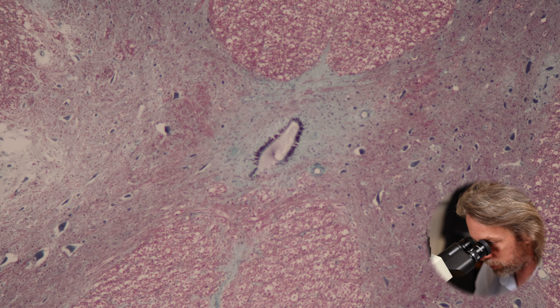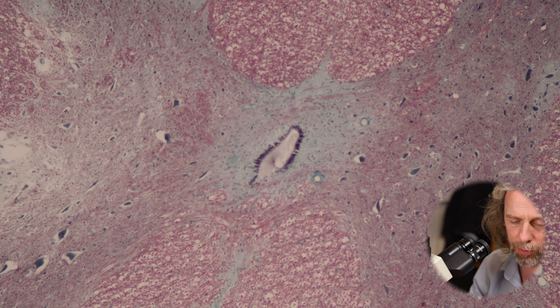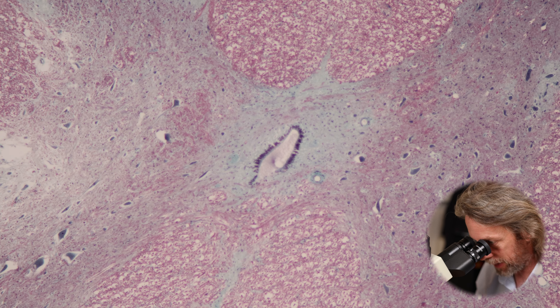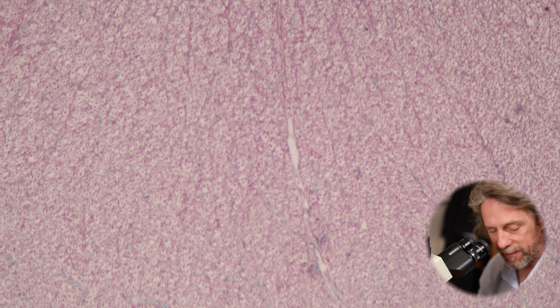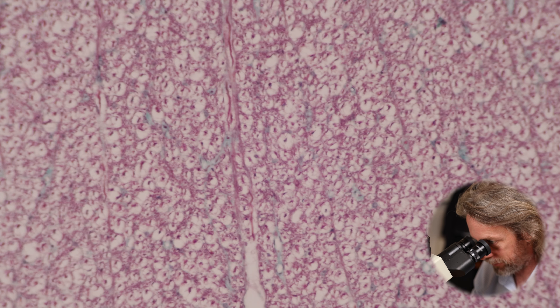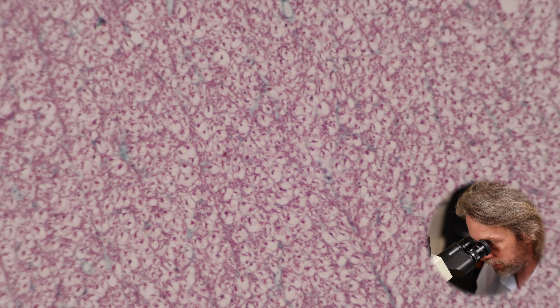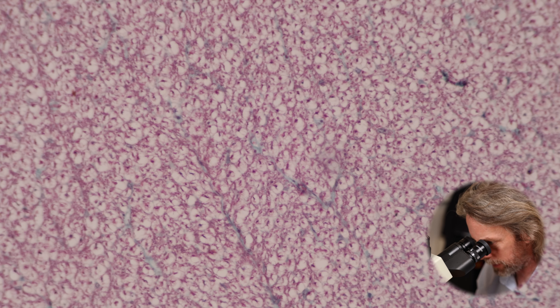Gray matter versus white matter: the gray matter is in the middle. In the spinal cord, gray matter is in the center and white matter is around the outside. When we look at the brain we'll find it's the opposite. The white matter is white because of the myelin. If we look at the white matter it probably looks fairly familiar, because we were looking at peripheral nerves recently.